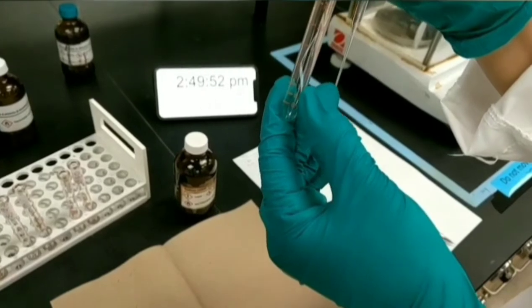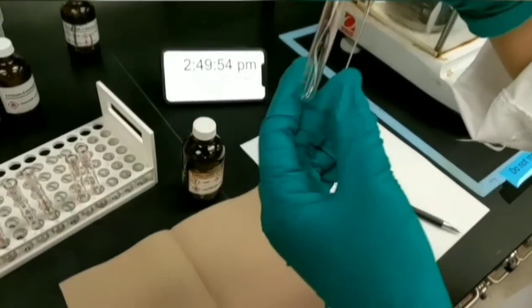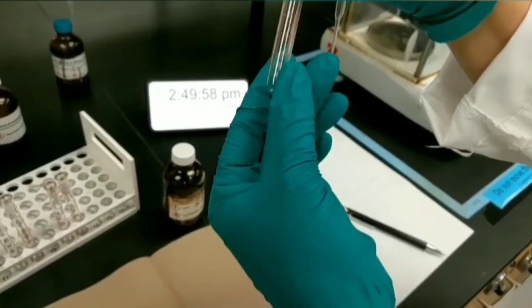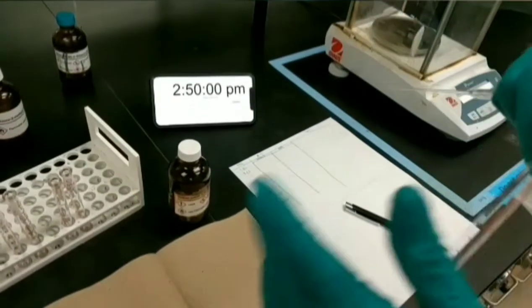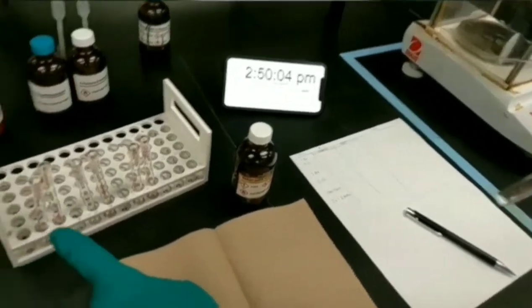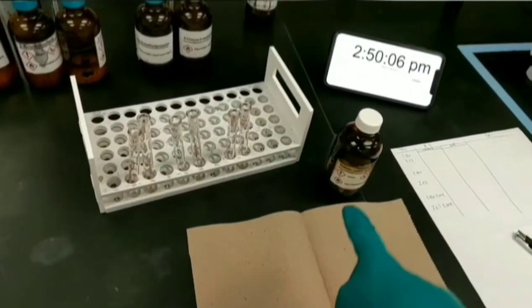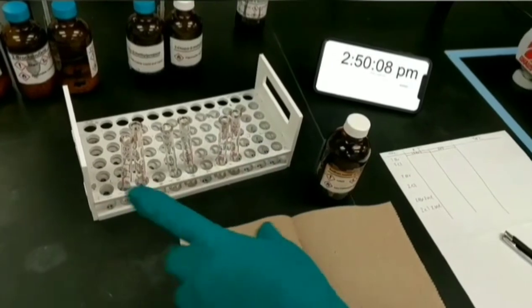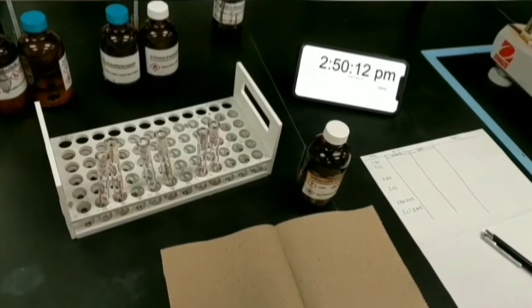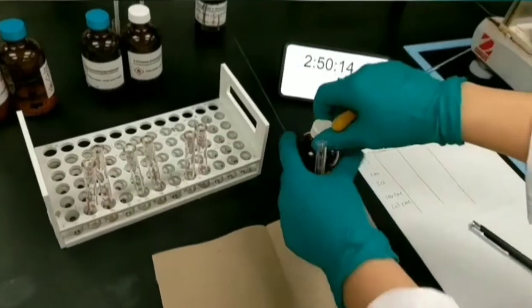And after measuring, I can add it into the test tubes of each alkyl halide. My first question is, what is the boiling point of each alkyl halide? Because we need to control the temperature of the water bath under those boiling points. You should write your answer in your lab report.